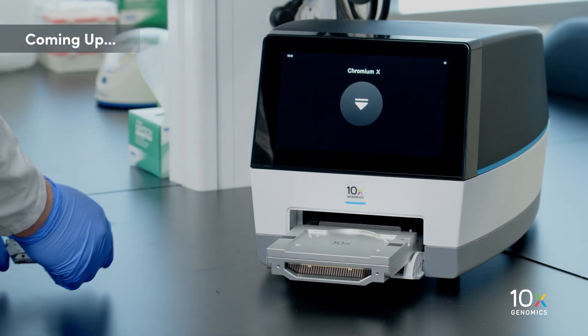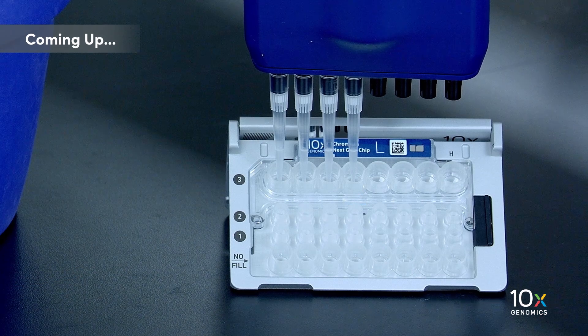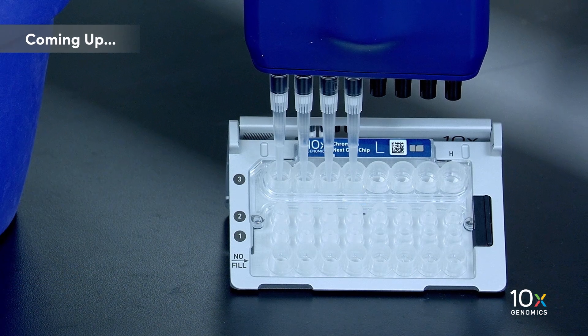After the run is complete, we will take the chip out of the Chromium instrument and transfer the gems from the recovery wells into a PCR strip tube.